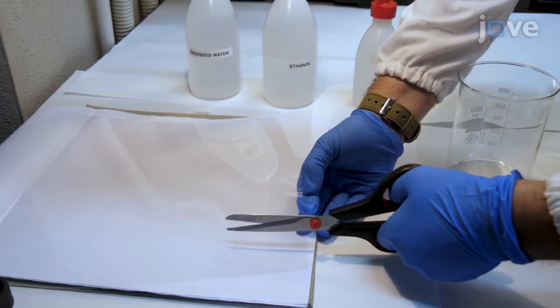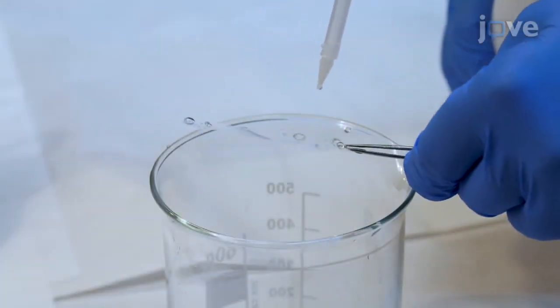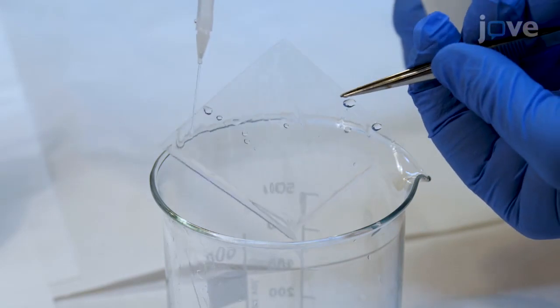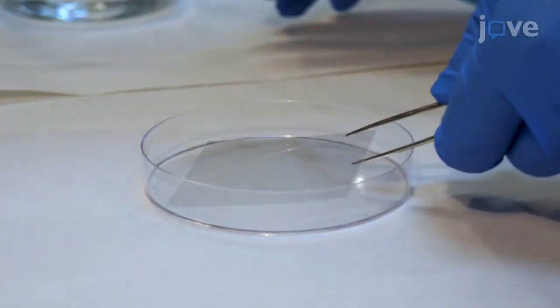Cut 6 by 6 square centimeter pieces from a new 250 micrometer PET sheet. Then, rinse the PET substrates with acetone, isopropyl alcohol, and deionized water. Dry them using streams of nitrogen and store them in clean plastic Petri dishes.